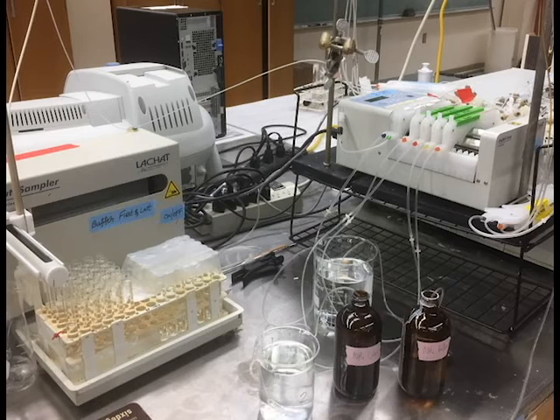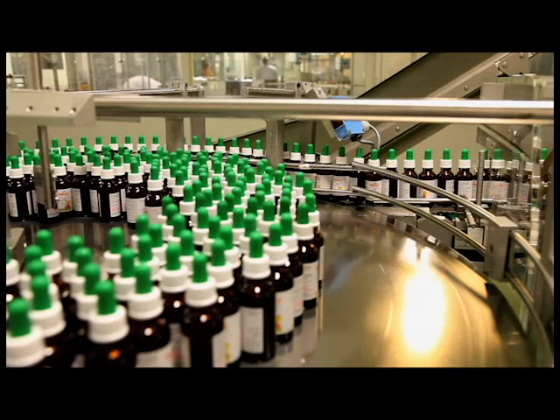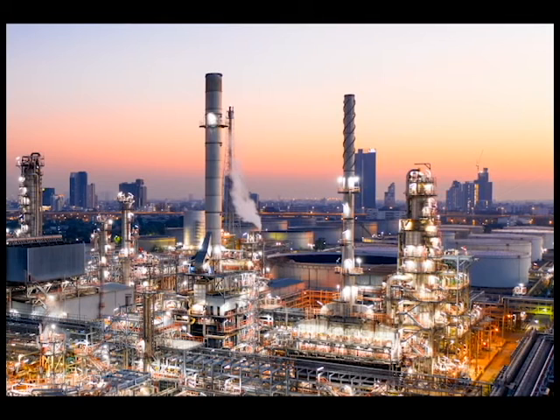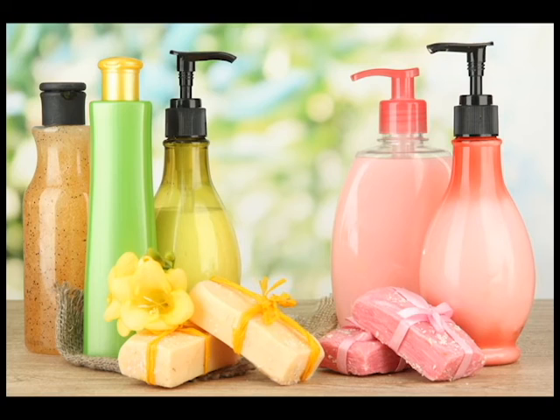To resolve this, further testing could be done by testing more bed heights, different weight percentages of activated carbon, and by testing different compounds being filtered. This experiment is applicable to manufacturing industries. Some industries that could use this technology would be pharmaceutical drug manufacturers, pesticide and herbicide manufacturers, and any industry that uses amines, such as agriculture, cleaning, gas treatment, personal care industry, petroleum, water treatment, and many more.